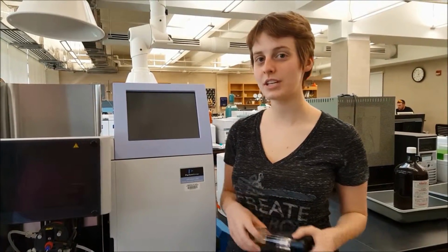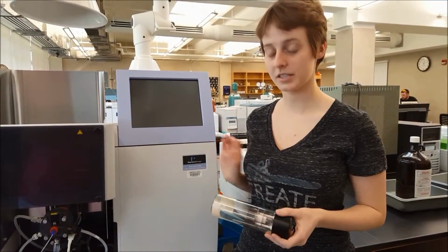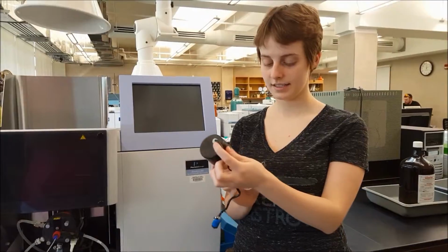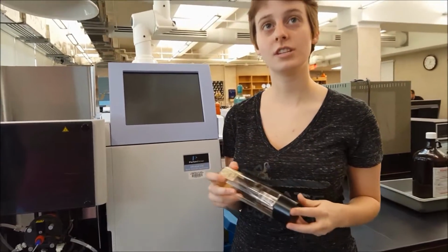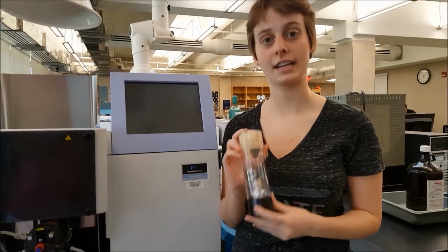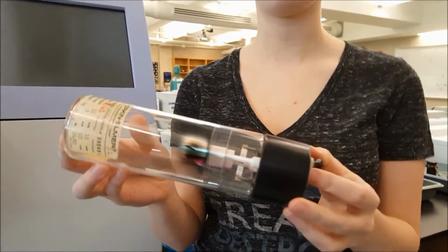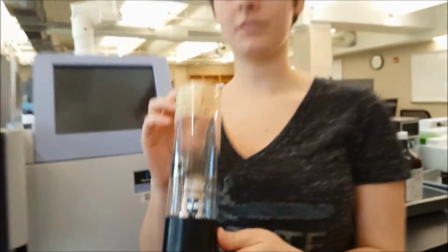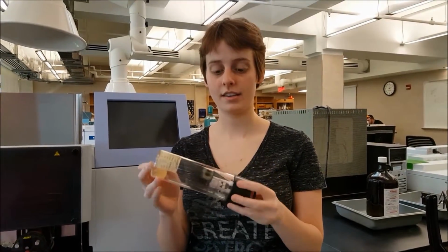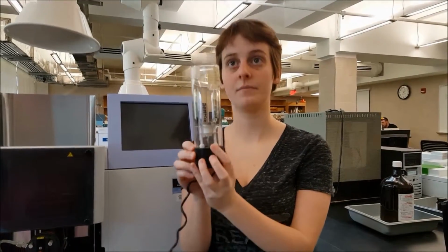Now I'm going to take you through each part of the Perkin-Elmer AAnalyst 200 AAS, and I'll explain how each part works. In my hands, I have a silver element HCL, which is a hollow cathode lamp. This lamp specifically is full of argon gas, but the lamp could be full of either neon or argon. So this one is full of argon, and the positive argon ion, when you turn it on, is going to be accelerated toward the metal cathode, which you can see in here.